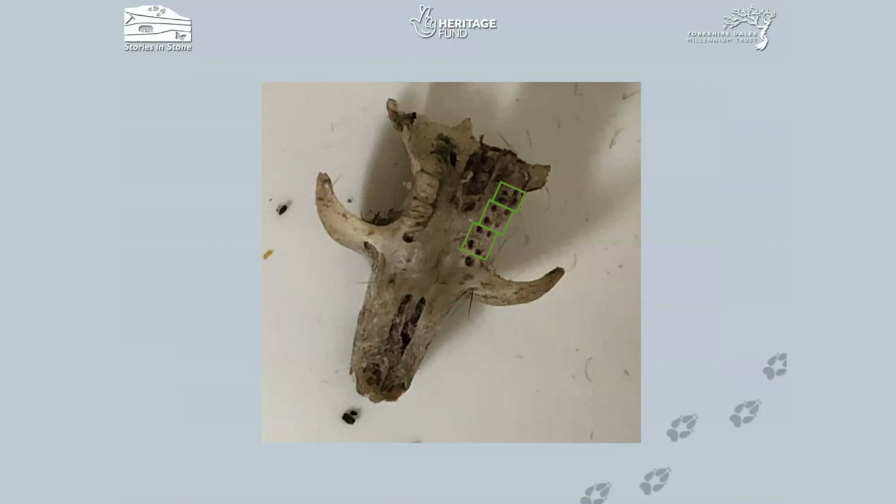I just wanted to finish off going back to the point I made previously about taking photographs to use as identification tools. So if you don't feel as though you're in a position to buy a hand lens or a magnification device, or you think, actually, my phone's really good, I'm going to take some pictures, I just wanted to show you that I took this on my smartphone, and it's not as good as the other photos that we've got, but it's of good enough quality for us to be able to see those root sockets on that skull and use this photo to help us identify the species that we've got.